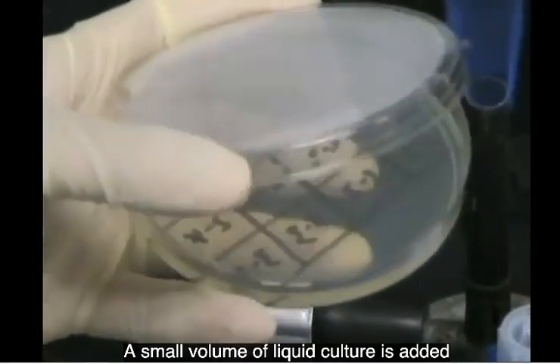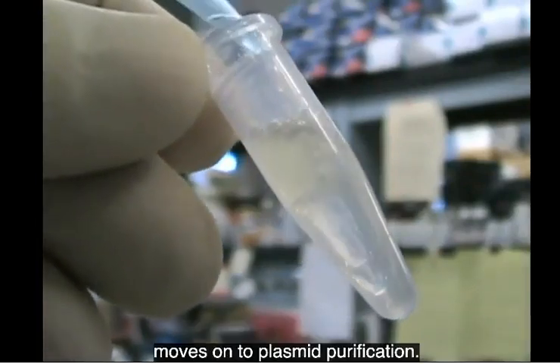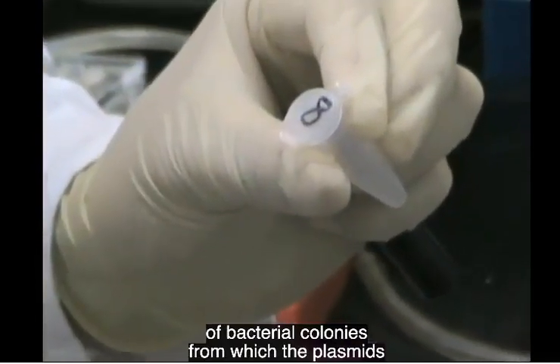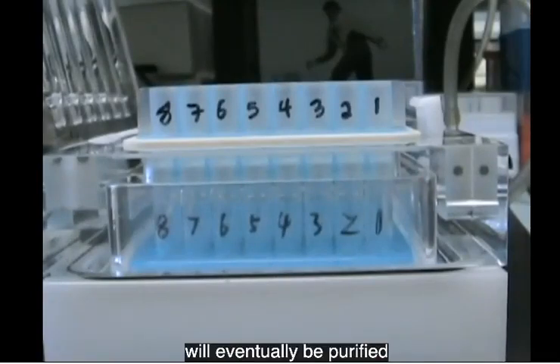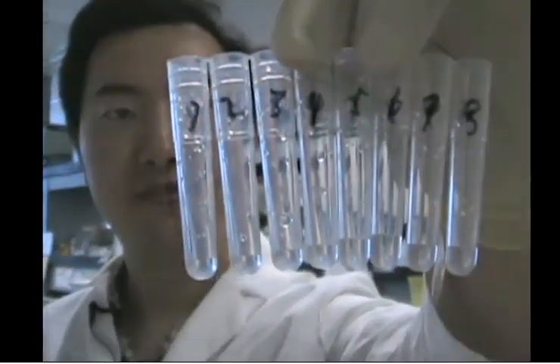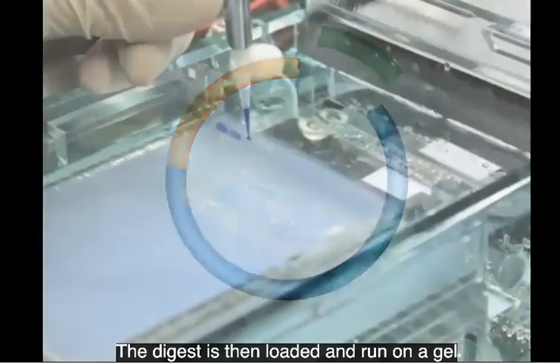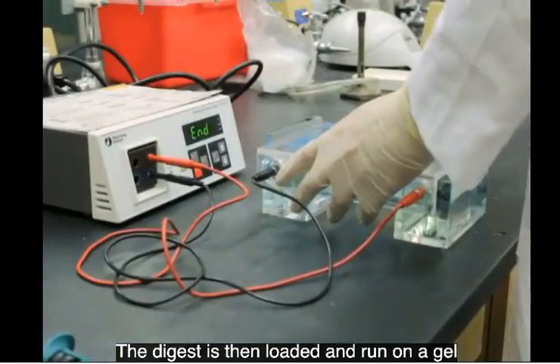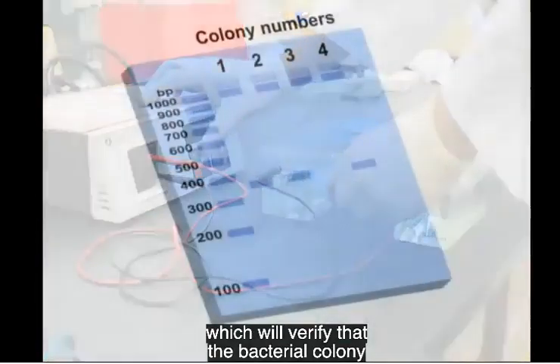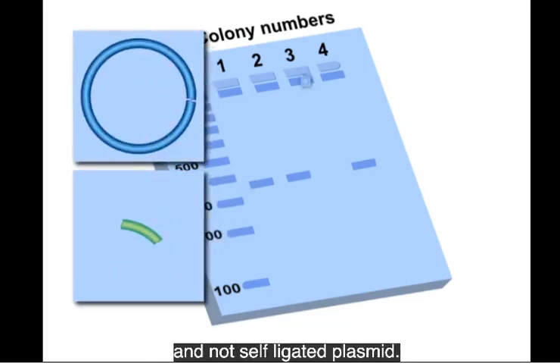A small volume of liquid culture is added to a numbered agar plate, while the rest of the culture moves on to plasmid purification. The numbering scheme that denotes the identity of bacterial colonies from which the plasmids will eventually be purified is maintained throughout the plasmid purification process. A sample of purified plasmid is then cut with restriction enzymes. The digest is then loaded and run on a gel in order to check for the presence of insert, which will verify that the bacterial colony was transformed with the plasmid containing an insert and not self-ligated plasmid.